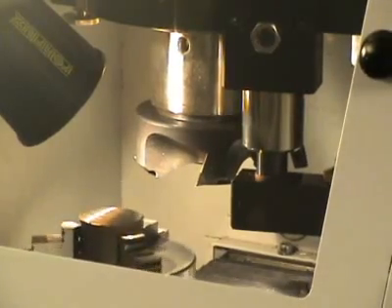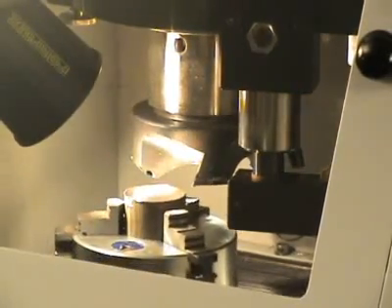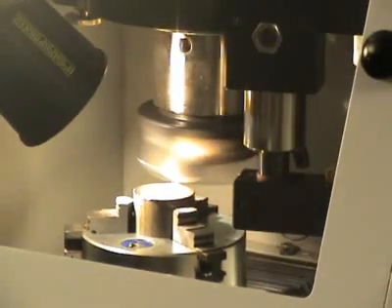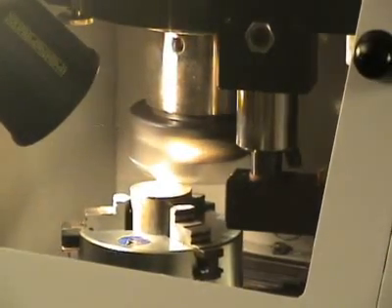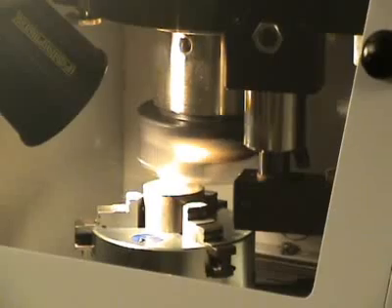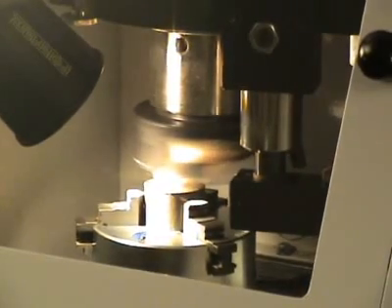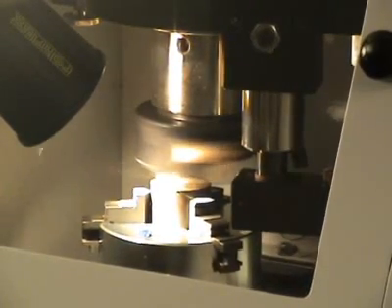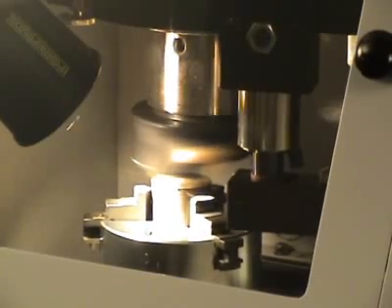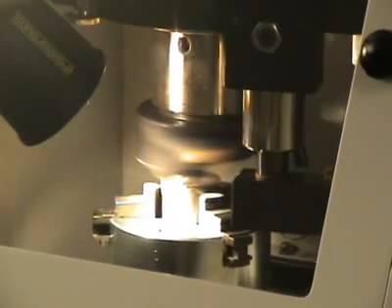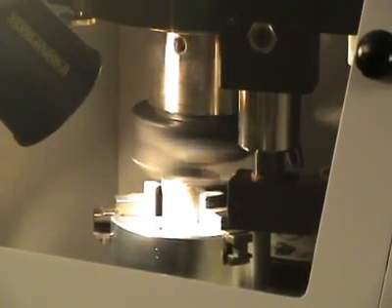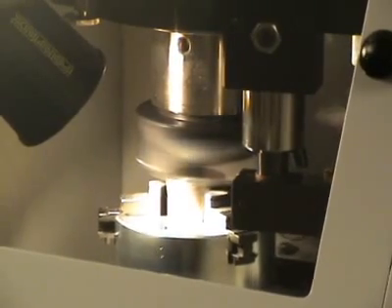Here you see the milling in detail and after each pass the sample stays fixed for one second in front of the cutting head. The cutting depth is adjusted for the next layer of cutting.